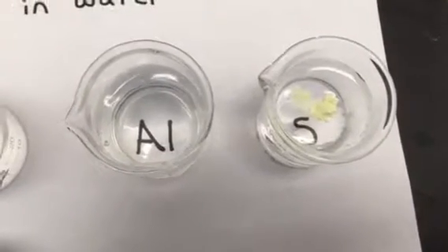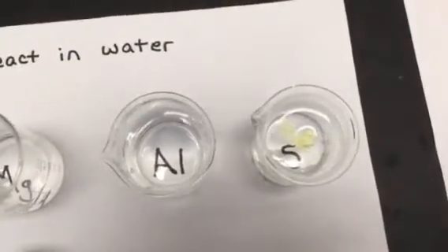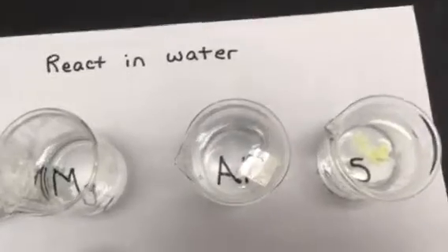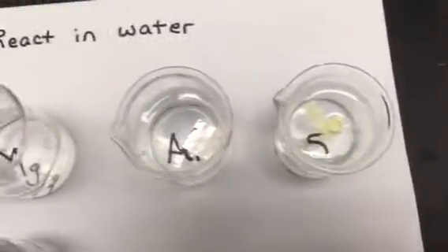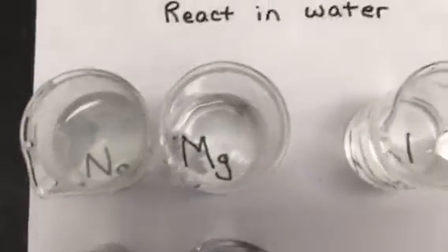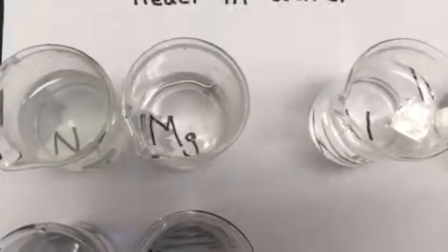The next one we're going to look at is going to be aluminum. So we're going to take and put in a piece of aluminum metal into the beaker there. And once again, nothing is really happening. So no reaction there either. The next one over, so these elements are all in the same row on the periodic table. They're all in the same period.